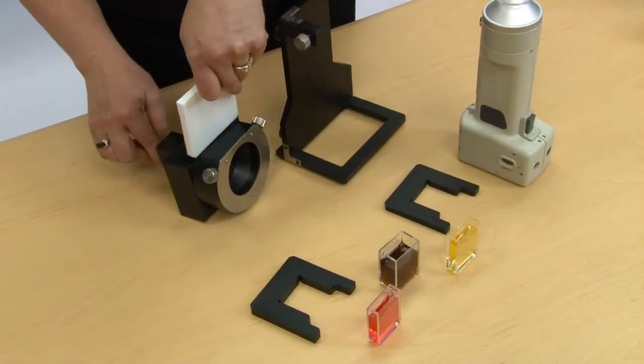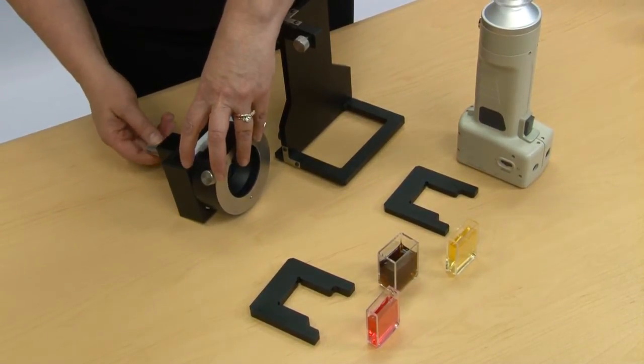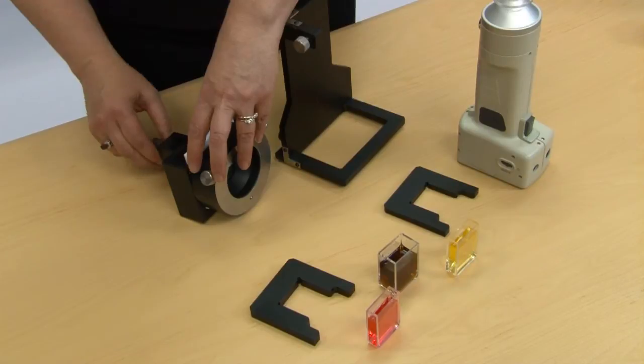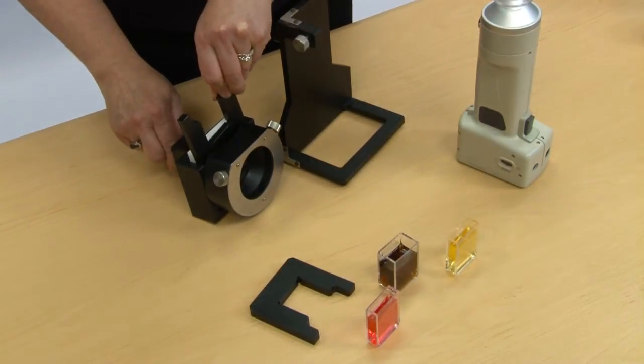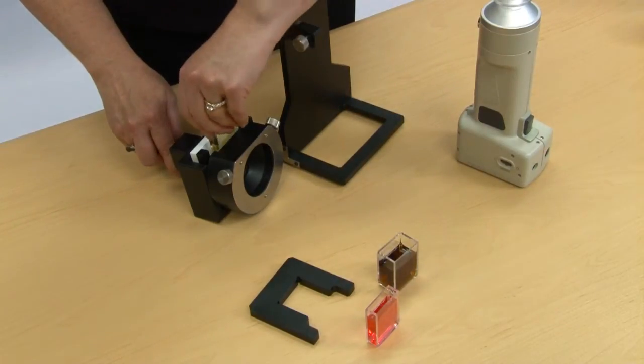To take a measurement with this accessory, place the white backing plate in the cell holder with the correct spacer for either the 10mm or 20mm cuvette. Place the liquid in the cuvette, place the CR400 into the cell holder, and you are ready to take a reading.